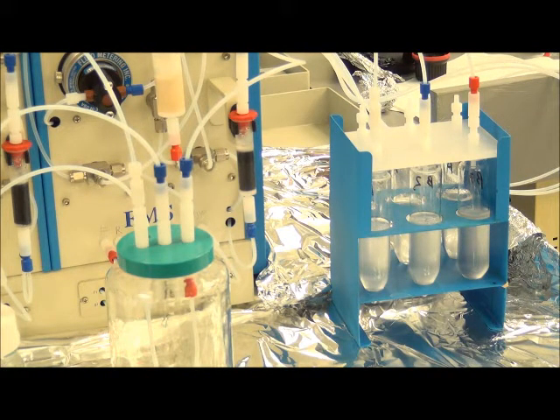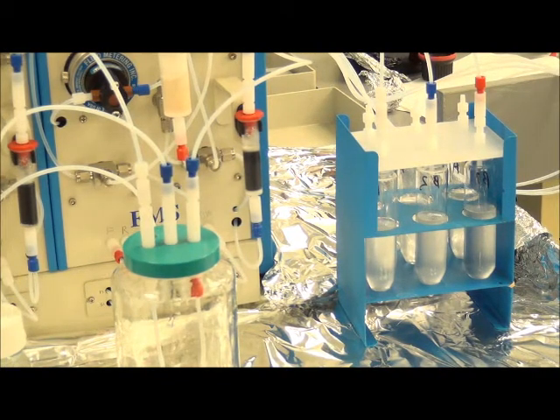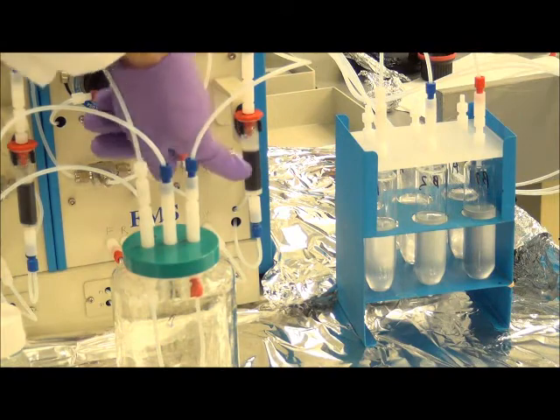And for fraction 2, there will be a total combined volume of approximately 45 mils as compared to 35 mils for the acid fraction, bringing the complete extract to approximately 90 mils for the entire 625 sample. And now the second cartridge.